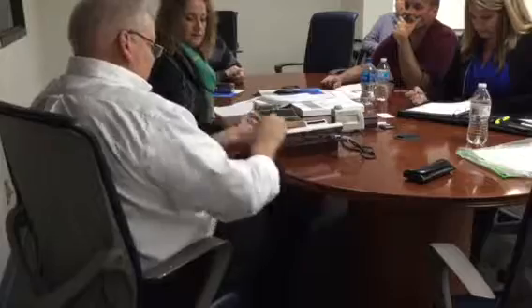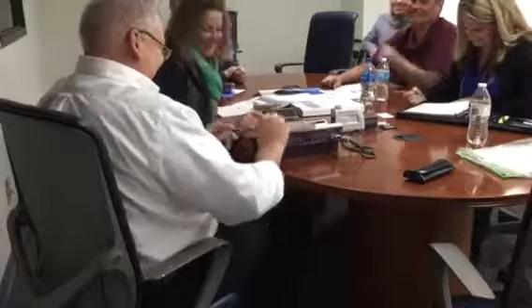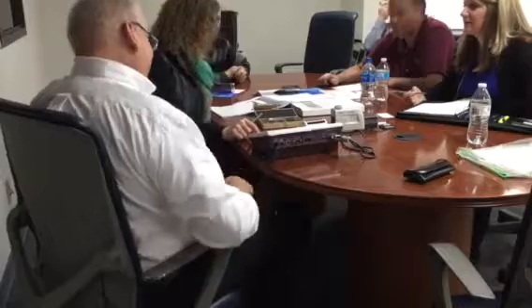You start from here. What standard do I wanna use? ISO. All right, okay. If you wanna use pencil... We hate that thing. Okay, Lambda c. Is it 0.08, right? Or is it 0.8? 0.8. Okay, good thing you didn't have the electrodes hooked up. I wrote down 0.8, so good. Let's hit the down arrow. Okay, that's okay. We're gonna go back into the cal condition. There you go. 0.8, and 5.